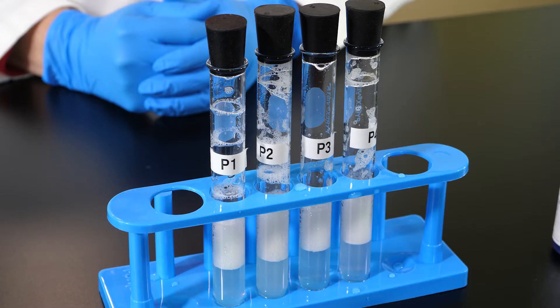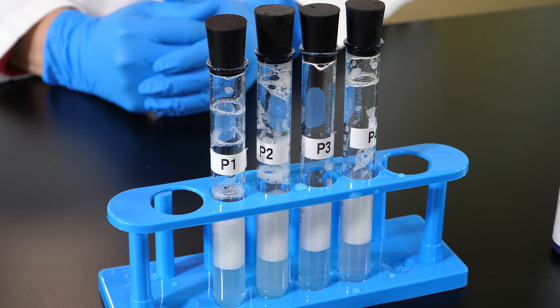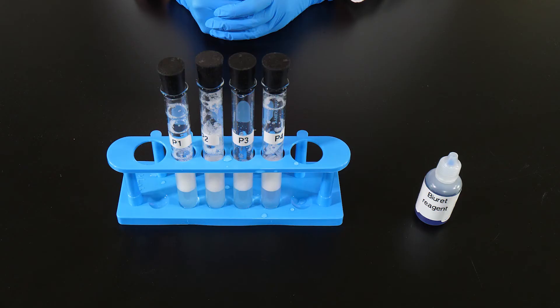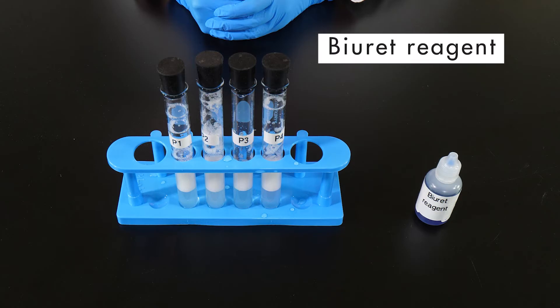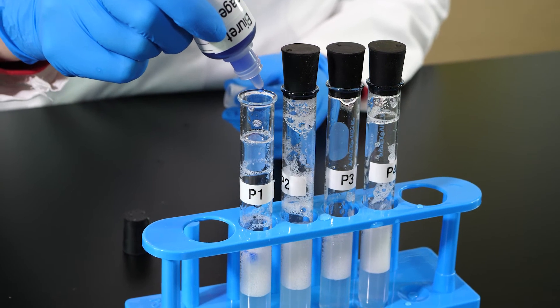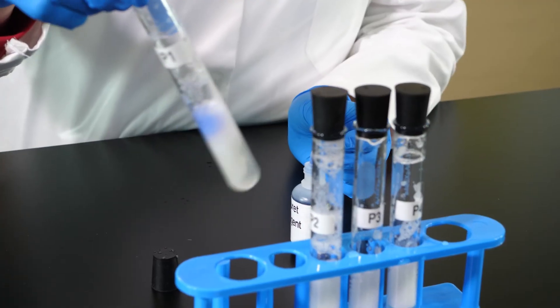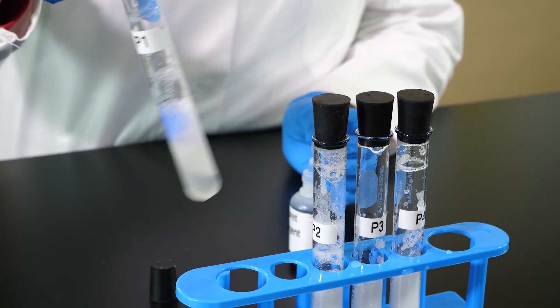Now we are ready to check each test tube for the presence of proteins. If proteins are present in a solution, it means protein digestion did not take place. The chemical indicator for this test is Biuret reagent. Six drops of the indicator are added to each test tube. If proteins are present, the Biuret reagent will turn purple.